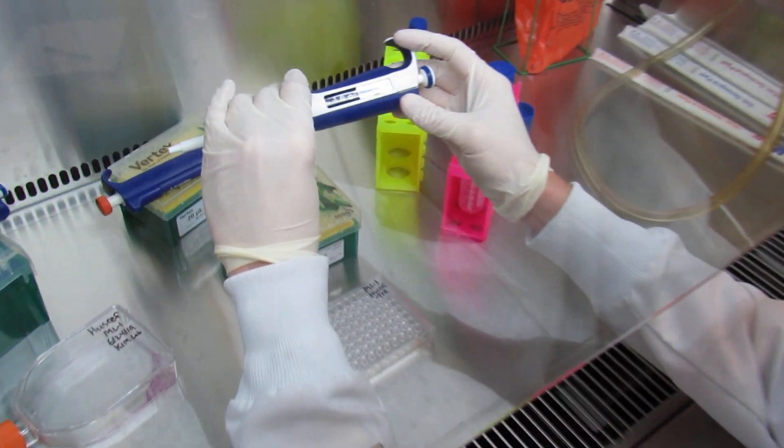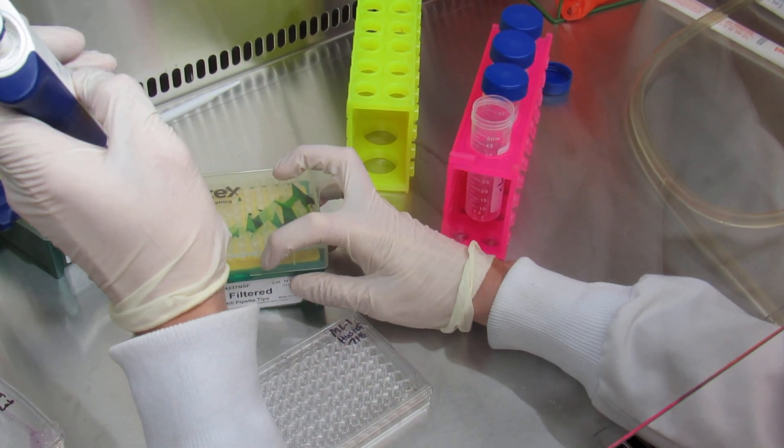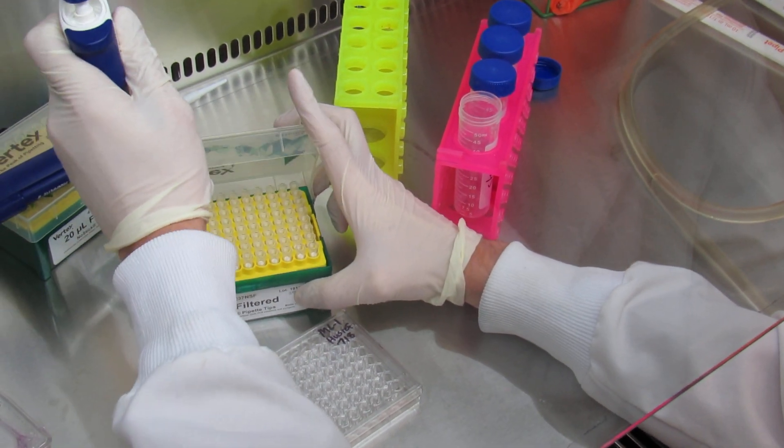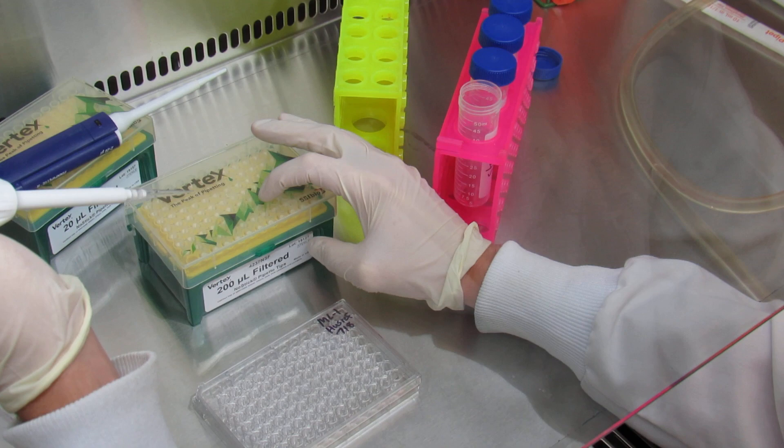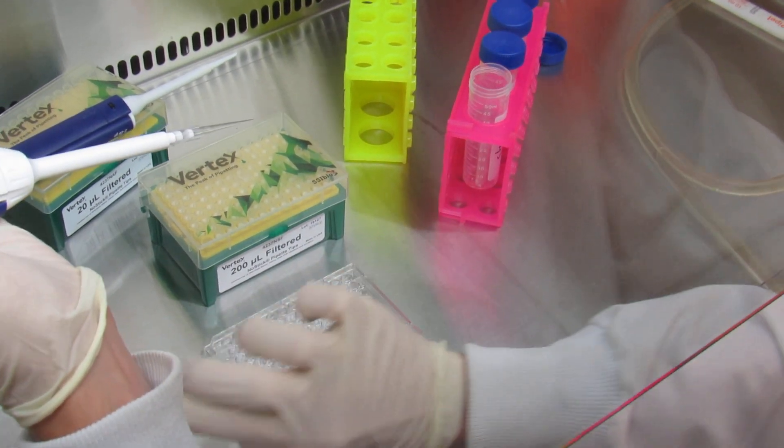Make sure you select the right micropipetter and have it set to 100, use the right filter tips, and set this aside.